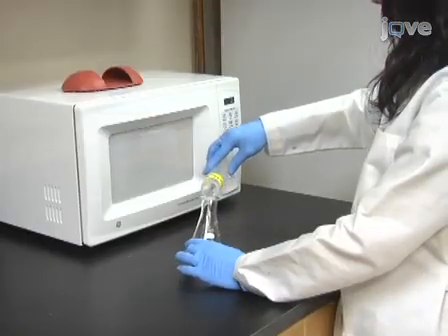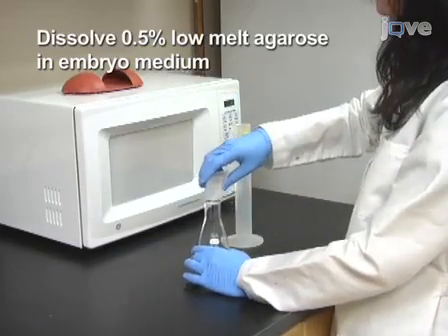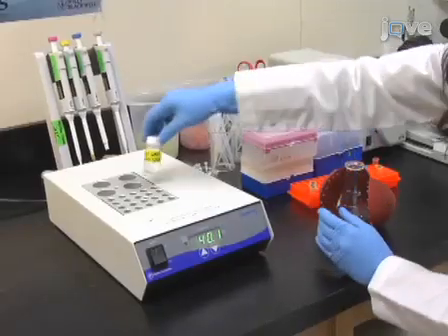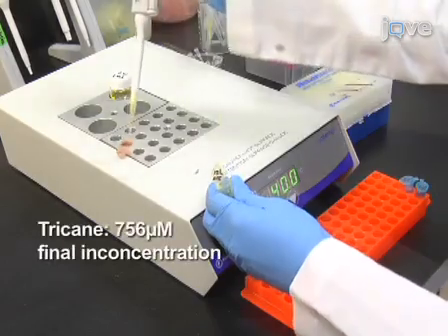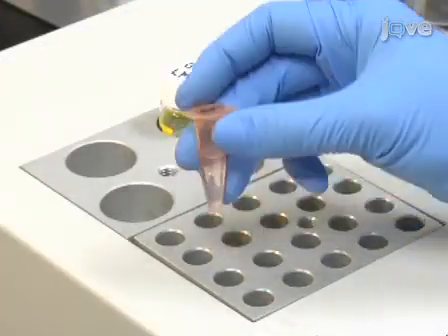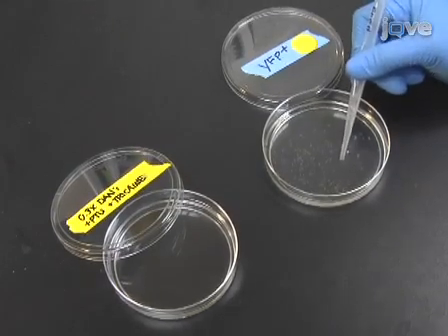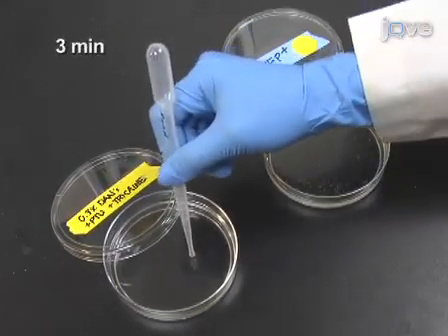Prior to imaging, prepare a 0.5% low-melt agarose mounting solution in embryo medium and store it at 40 degrees Celsius. Add tricaine and PTU if necessary. Mix gently and return to 40 degrees Celsius. Anesthetize the fish by placing them in embryo medium containing tricaine for approximately 3 minutes. The fish will become non-responsive to touch.